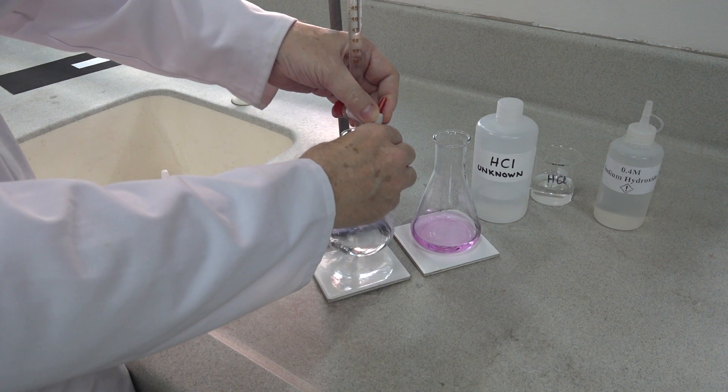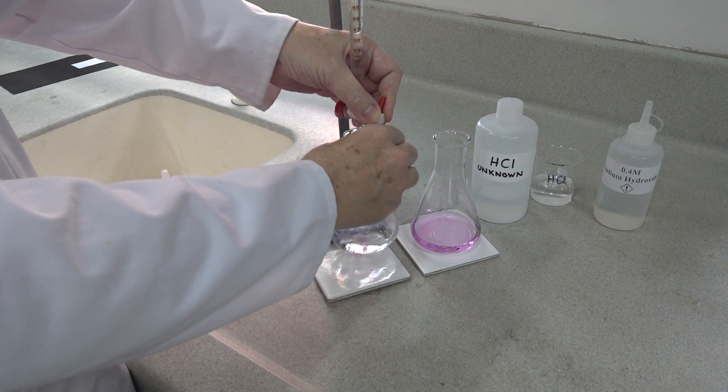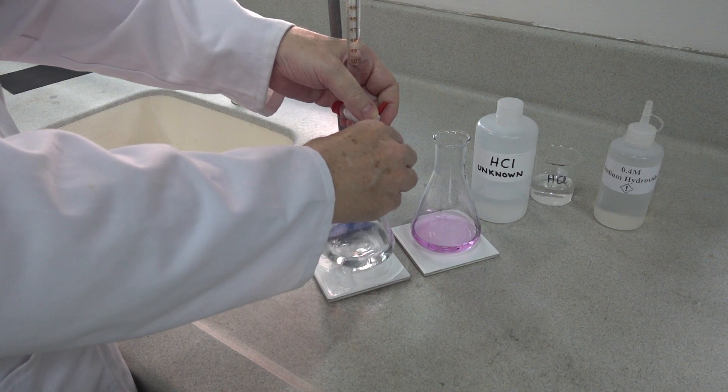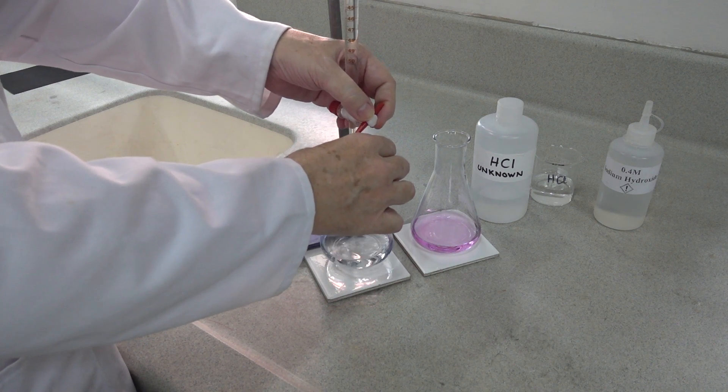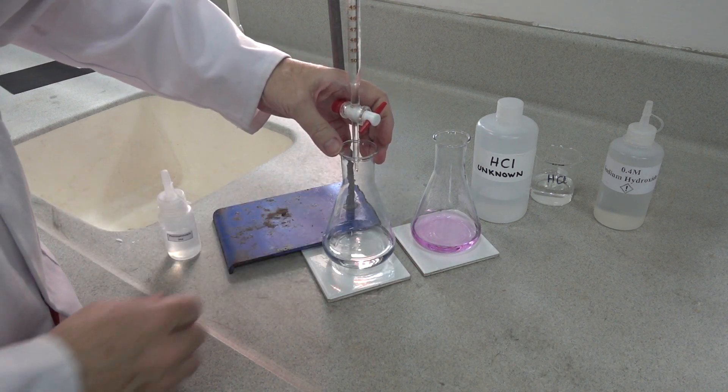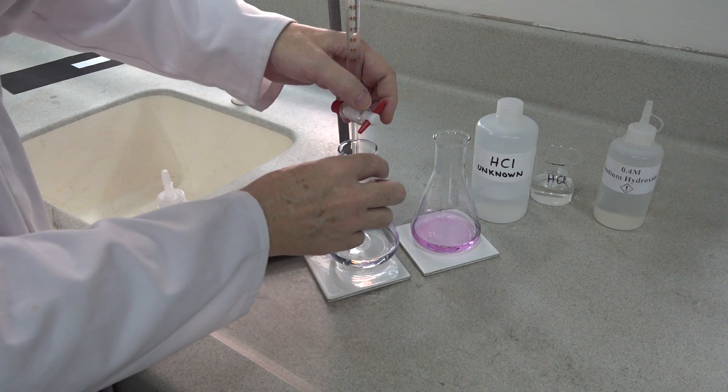We can afford to add another mil. We've still got a colorless solution. Now we can start to add alkali dropwise.